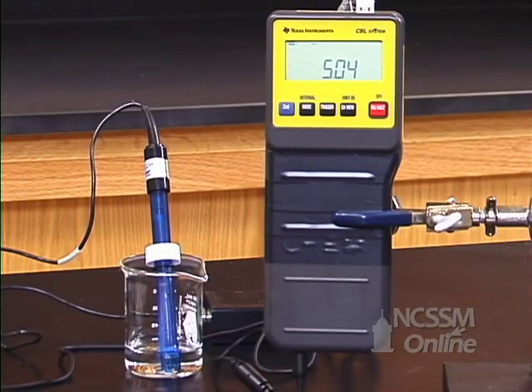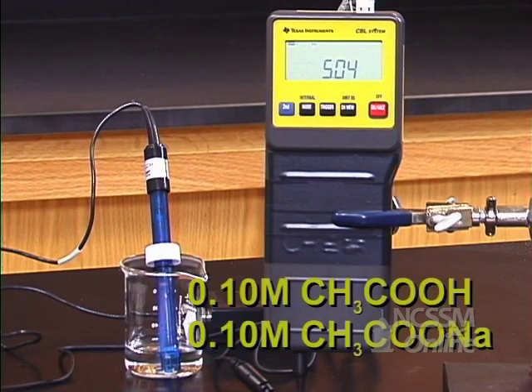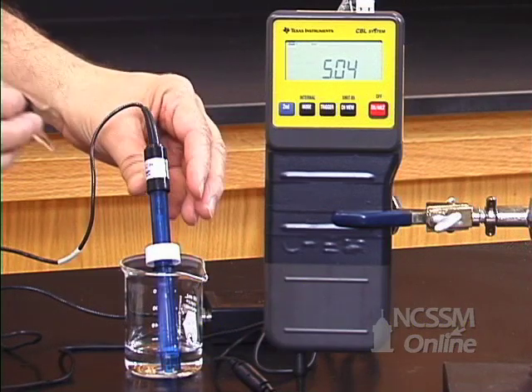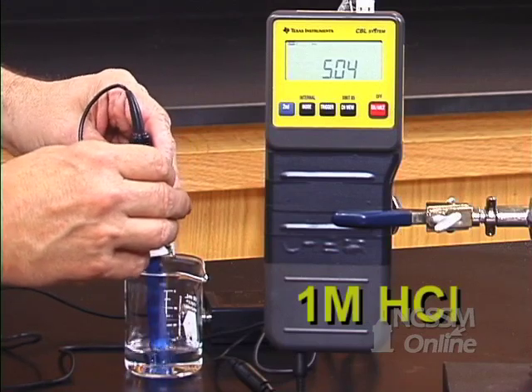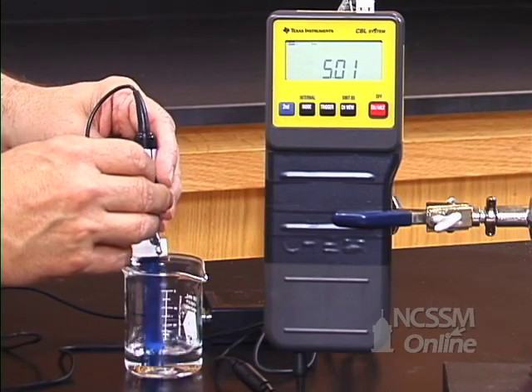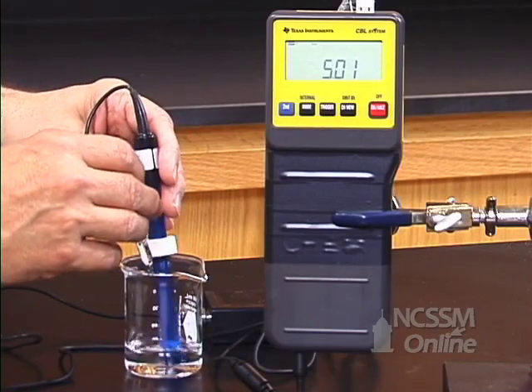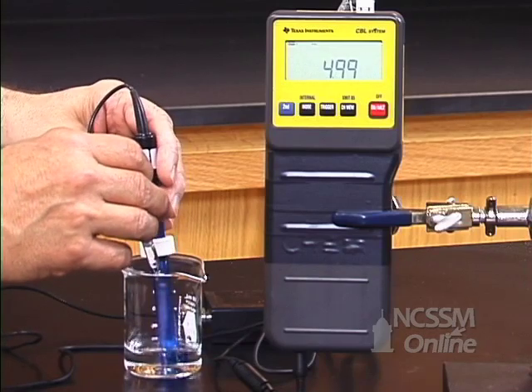I've got another sample of the 0.1 molar acetic acid, 0.1 molar sodium acetate buffer. I'm now going to add one molar HCl. I've added one drop, and the pH has changed only slightly, whereas with water, the pH dropped rapidly.